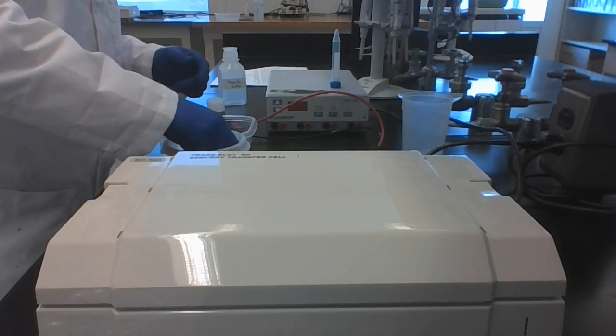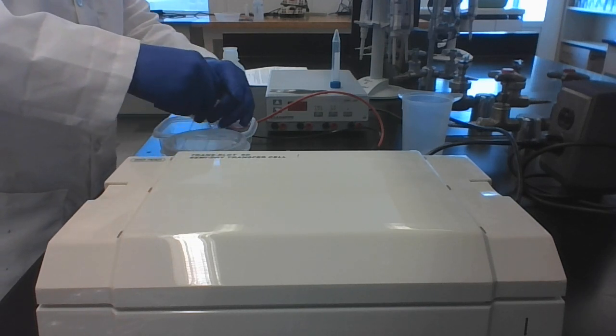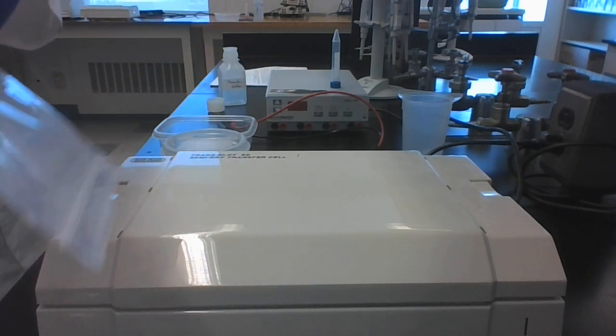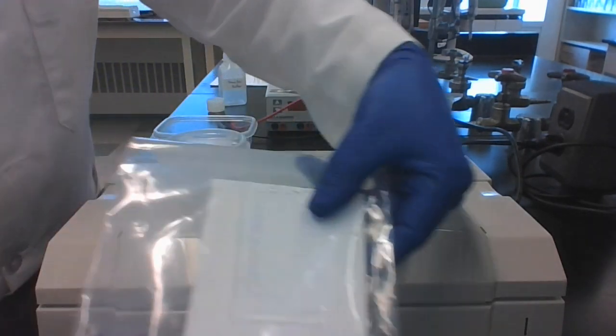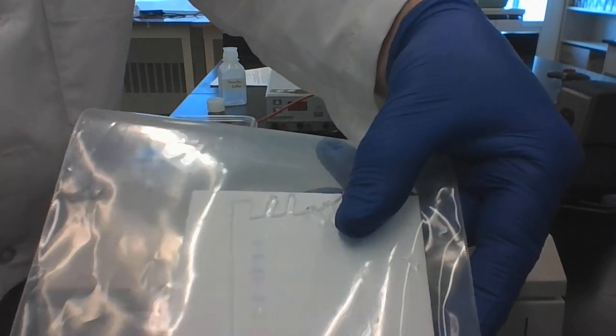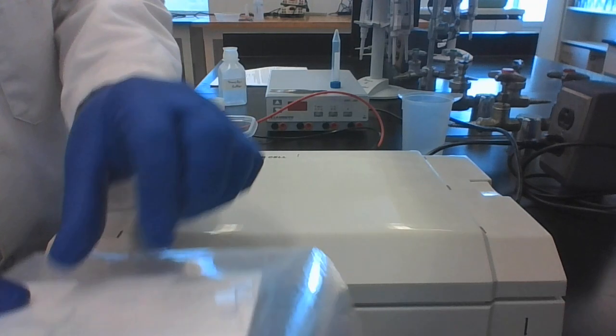So we have our gel sitting here in water. We want that also in transfer buffer. As you can see the molecular weight standards on the gel, they're in the gel. We're going to put that into the transfer buffer.